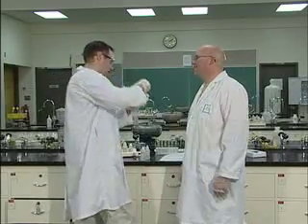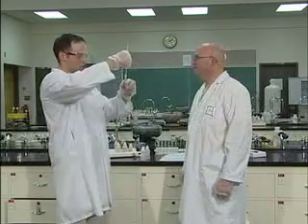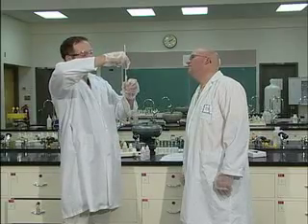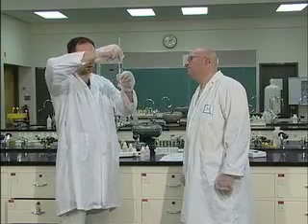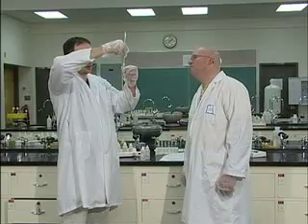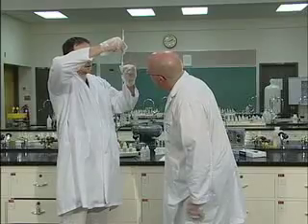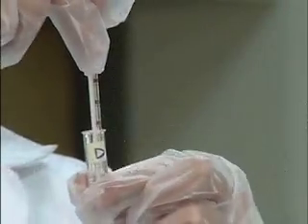Okay, and the other thing we're going to do is take the temperature change again. We're going to try and find the final temperature. And again, for this one here, it might change a little bit. In fact, it is going up probably 2 or 3 degrees because you're adding a strong acid to a weak base. So you're going to get a little bit of temperature change. But for the most part, you will also notice there's a little bit of fizzing, some bubbles forming. And you'll notice that, of course, your solution has gone back to being clear.